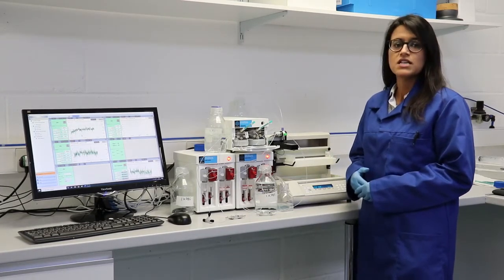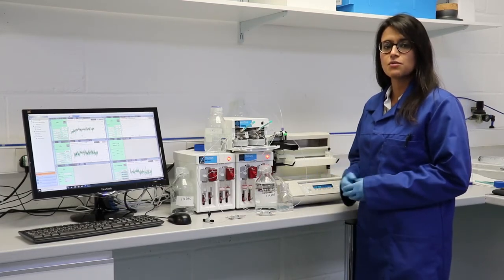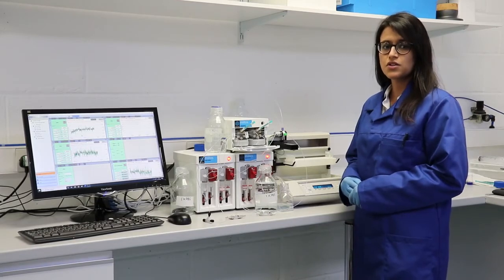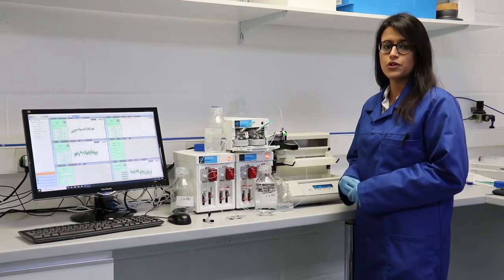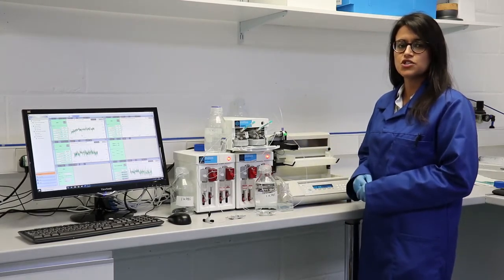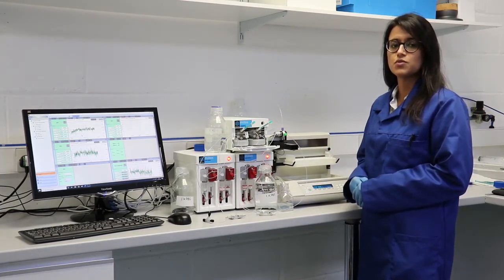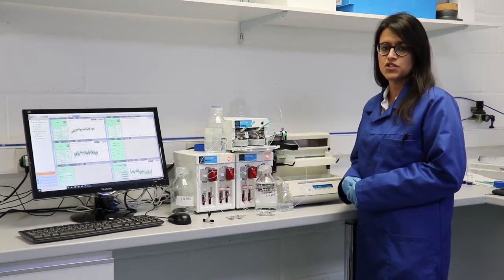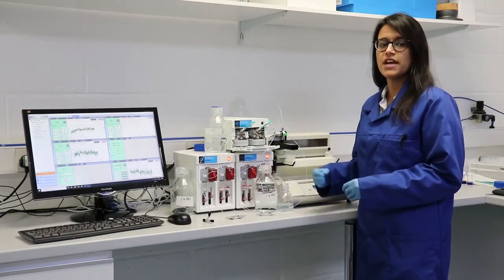Traditional methods, such as homogenization and thin film hydration, are laborious, produce polydispersed lipid nanoparticles with low encapsulation efficiency, and require large volumes. With microfluidic technology, you can overcome these issues and produce lipid nanoparticles which are monodispersed, reproducible, have high encapsulation efficiency, and use low reagent volumes.